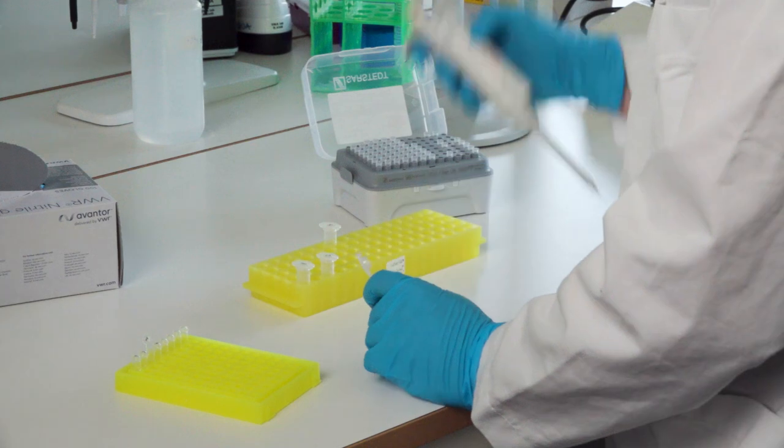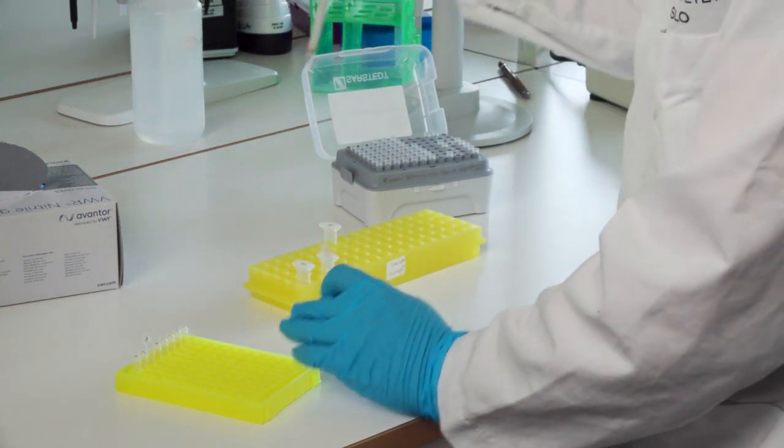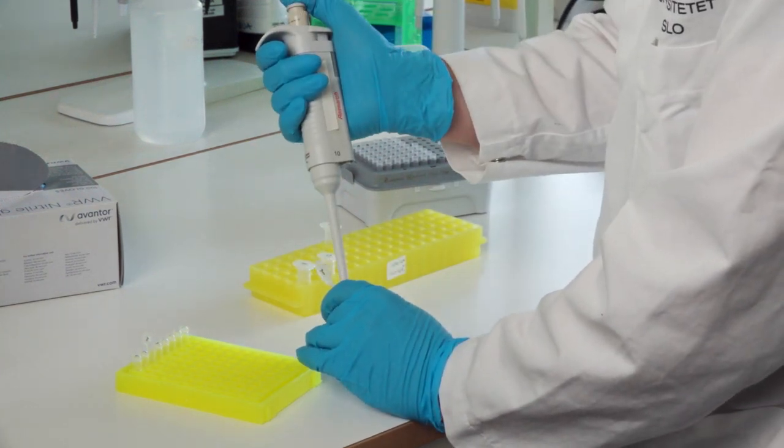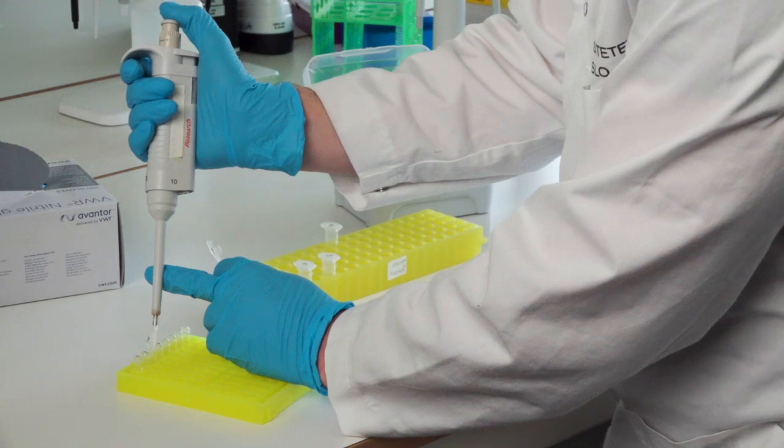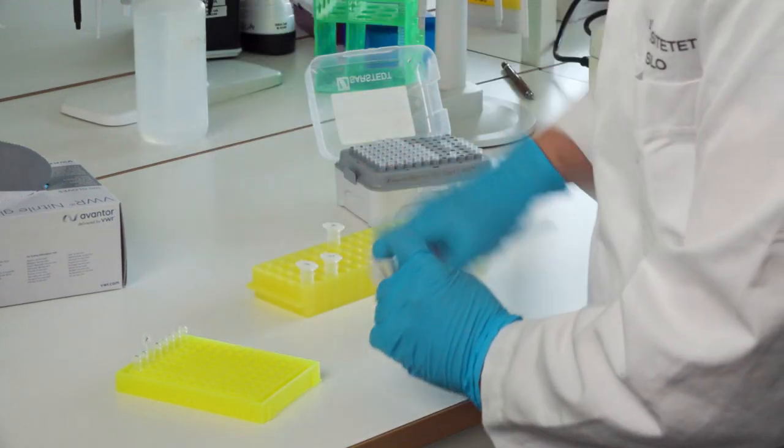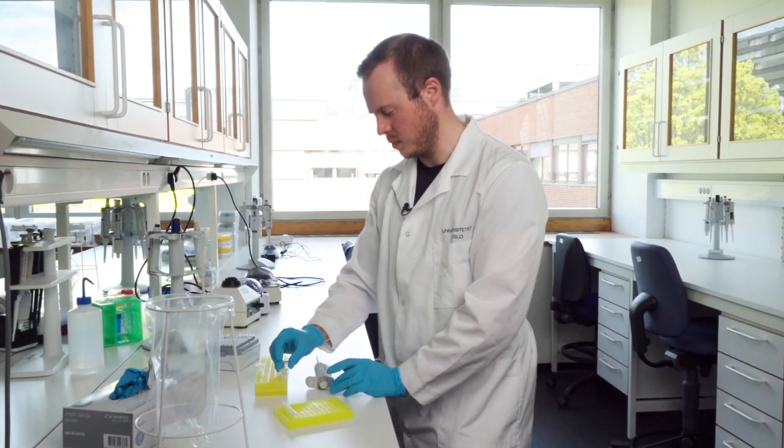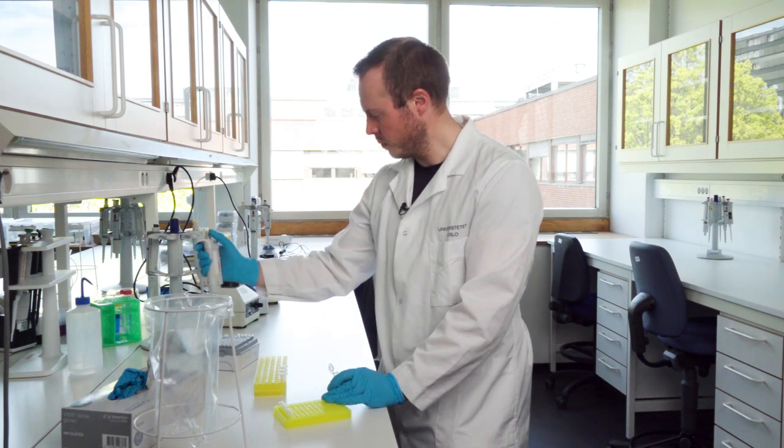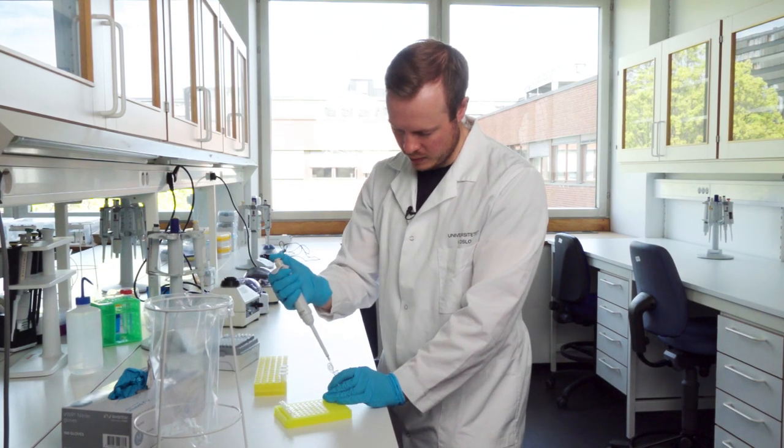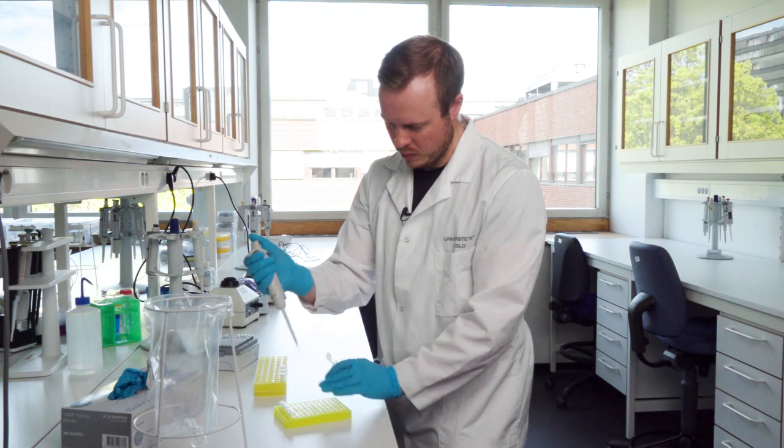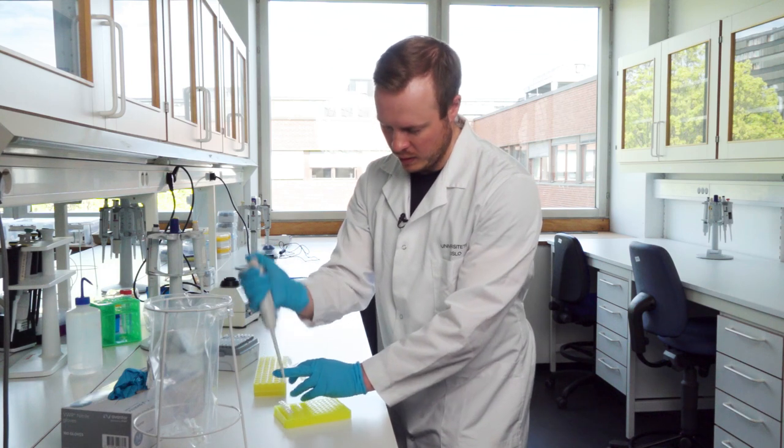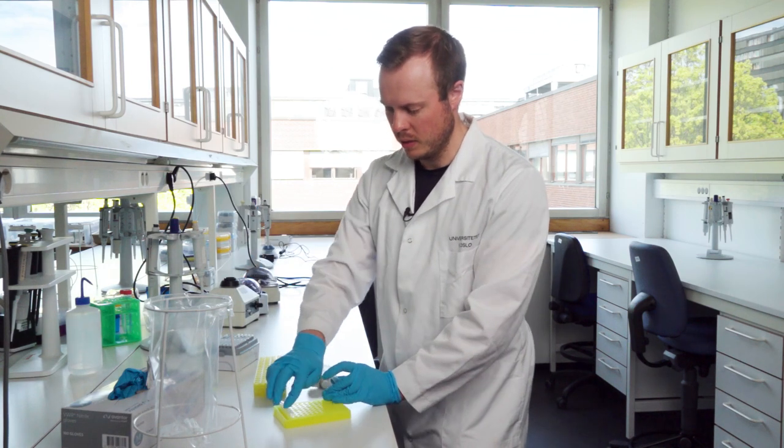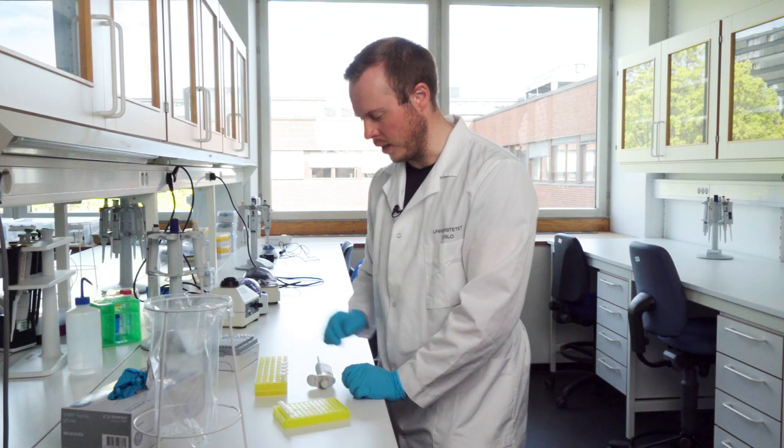Now we are on sample 3, add it, move it down, then sample 4, then we add it. There we go. So now we have added all the samples.